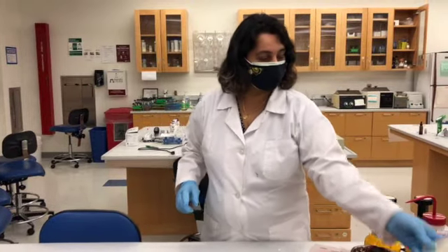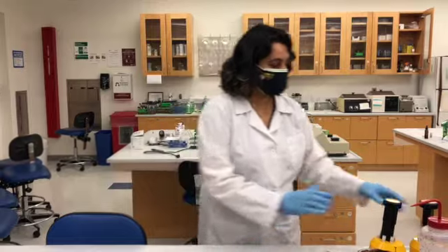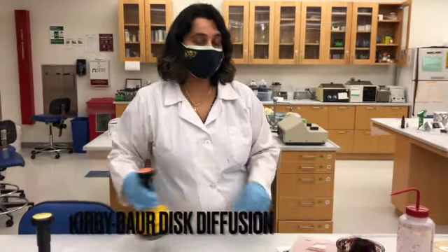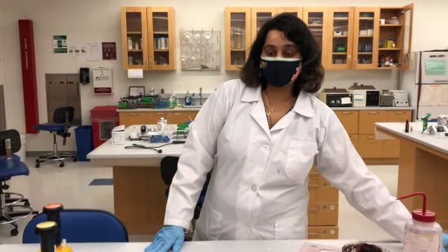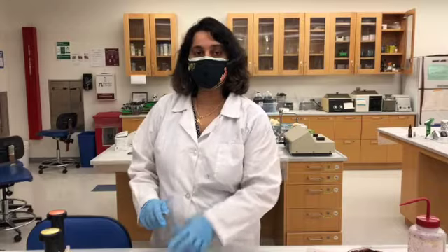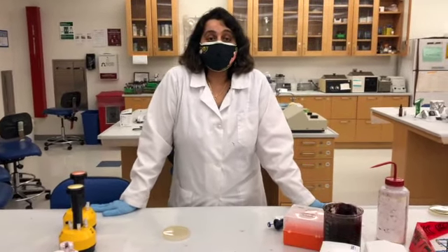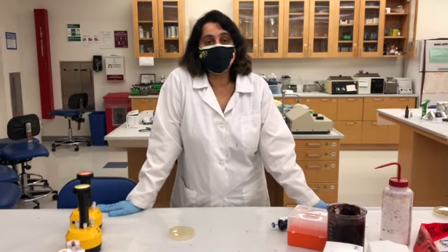So all we need to learn in this lab 5 is about a very important technique that's known as Kirby-Bauer disk diffusion method. So Kirby-Bauer disk diffusion method is the standard method that is used by many diagnostic laboratories to check the antibiotic susceptibility or resistance of a microorganism.